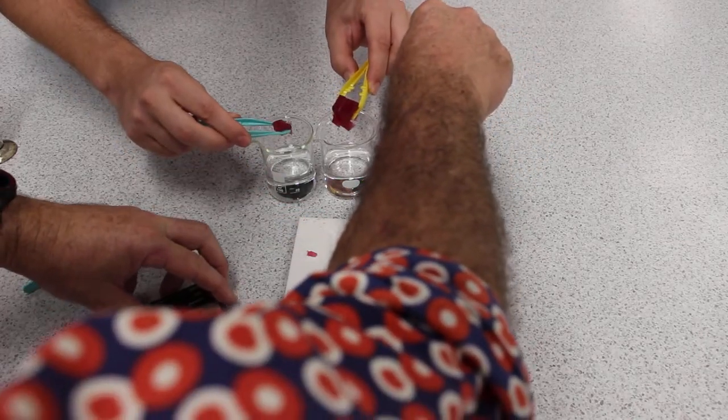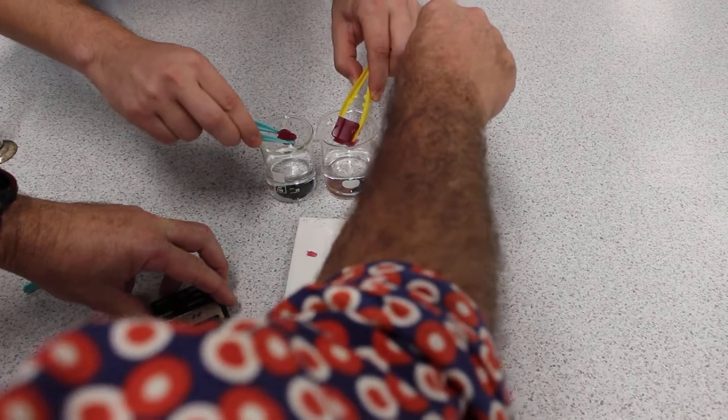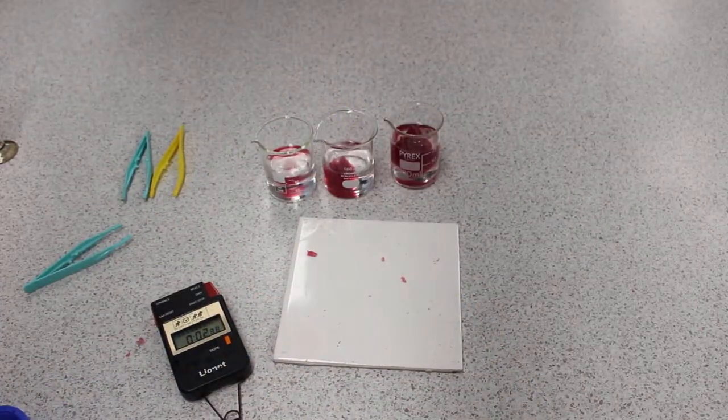Put them all in at the same time - you need to have a friend doing that - and set the stopwatch off. That was almost right.